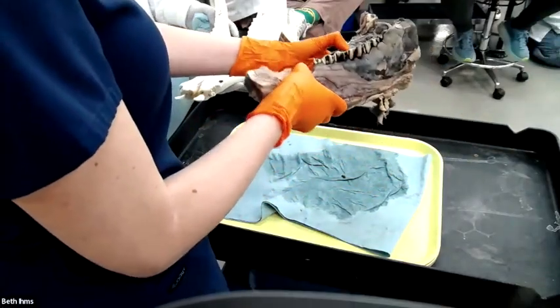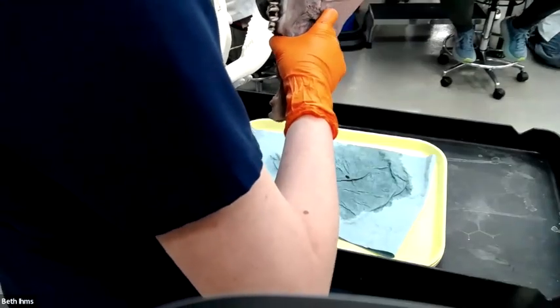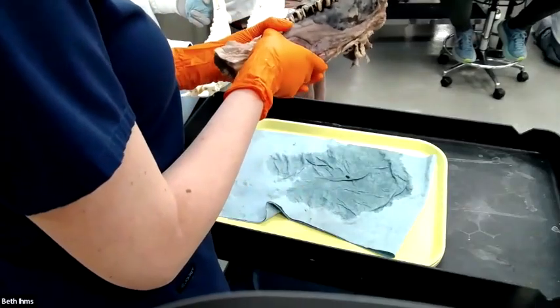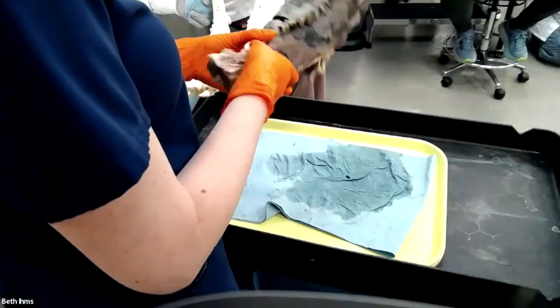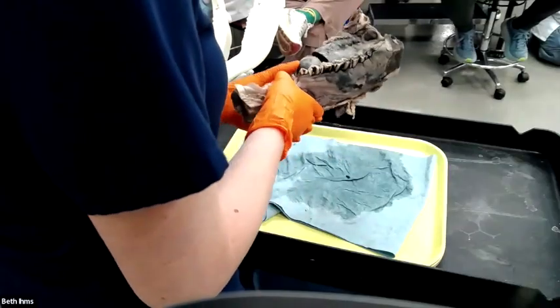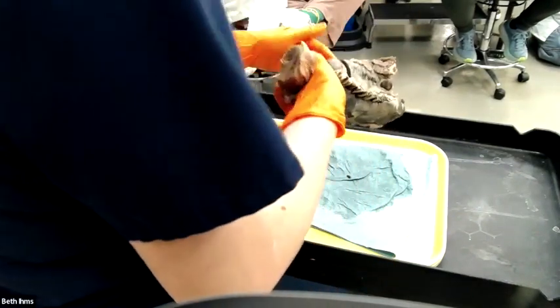Firm. Firm to hard. I think some parts of this are hard. I think there is bone in here. Did I hear multinodular? Great. Perfect. I can see discrete nodules on the cut section here. How about the color? Gross. I can't draw gross. It's like dark gray, brown, black almost on the cut section. It almost looks like muscle. It's like dark red. Very, very firm.